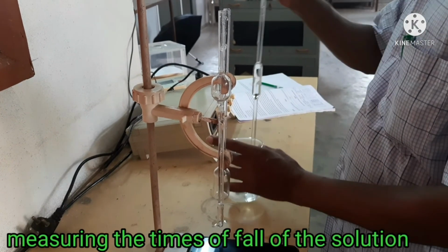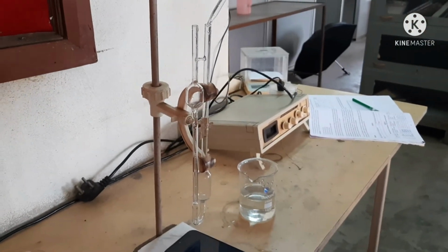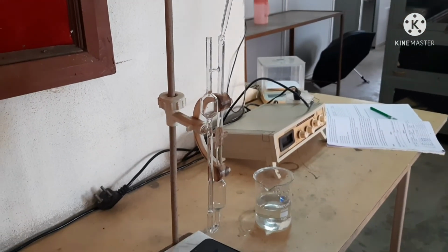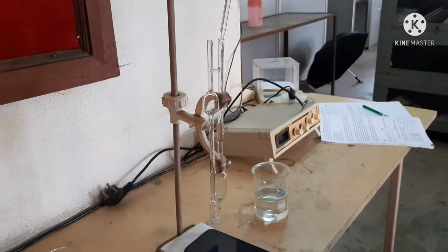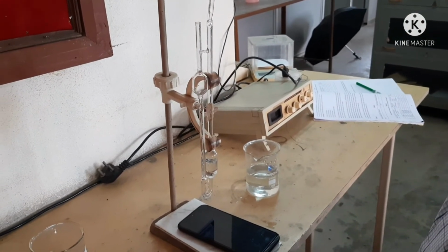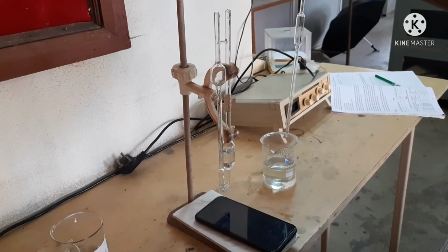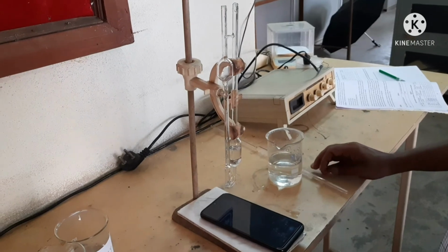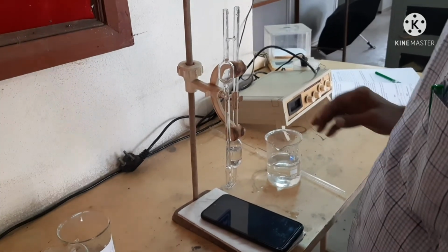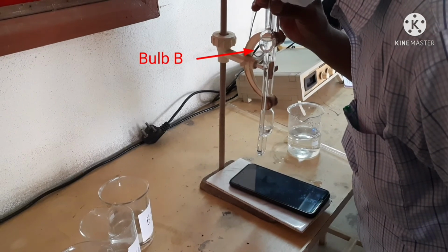Our viscometer is well set by the burette stand and clamp. Now we are filling the lower bulb of the Ostwald viscometer with distilled water with a pipette. Then we suck up the water to the upper bulb.